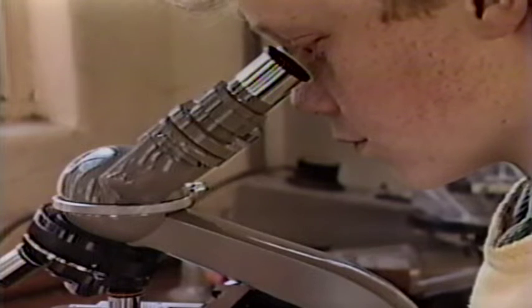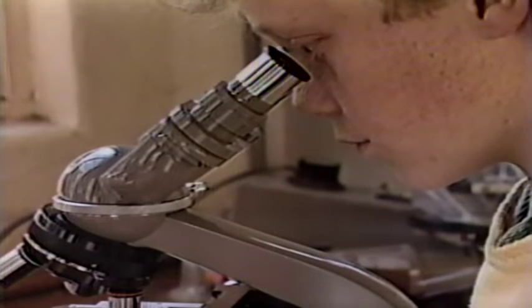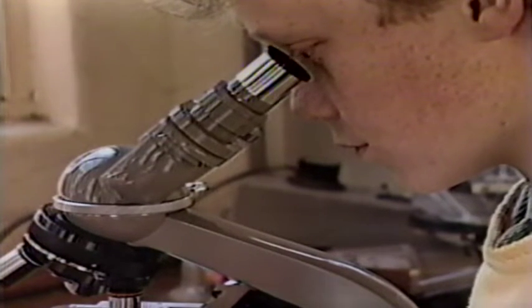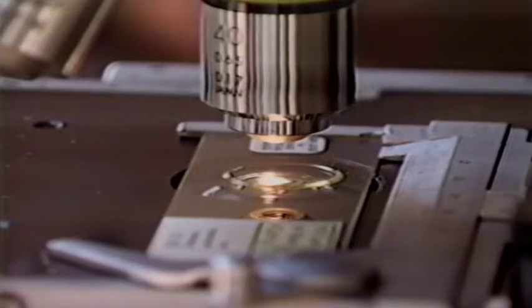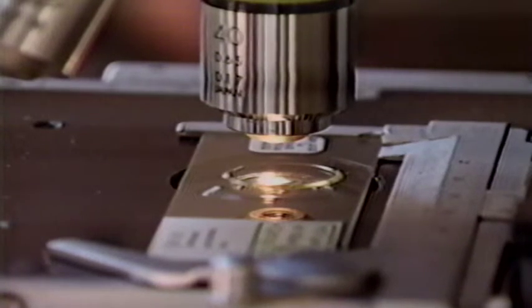Even when using a monocular microscope, it is a good practice to keep both eyes open, as this prevents eye strain and makes focusing easier. The amount of illumination on the specimen can be modified in a variety of ways depending on the type of microscope. To attain the best image, the tiny opening of the objective lens should be completely filled with light of the proper intensity passing through the specimen.